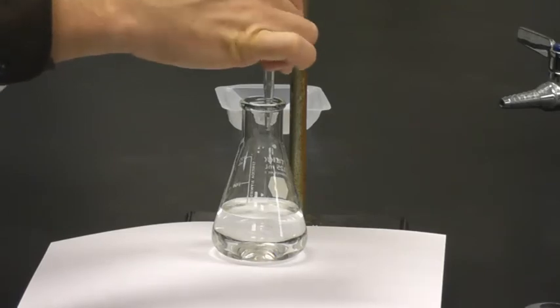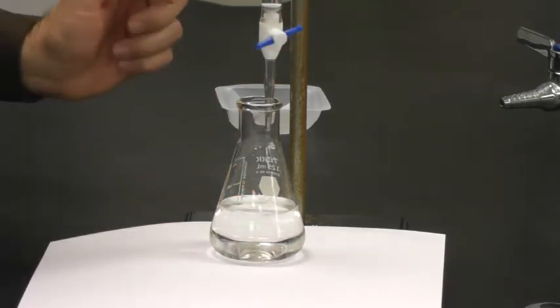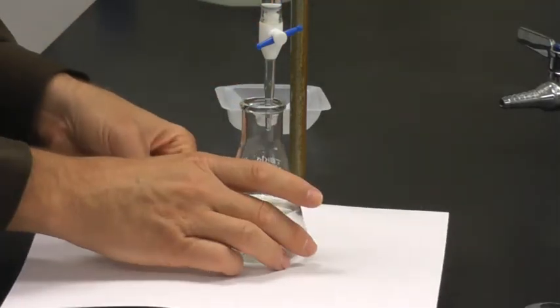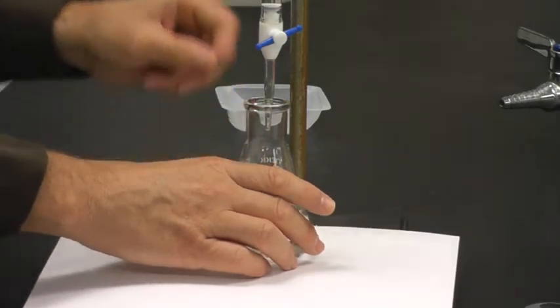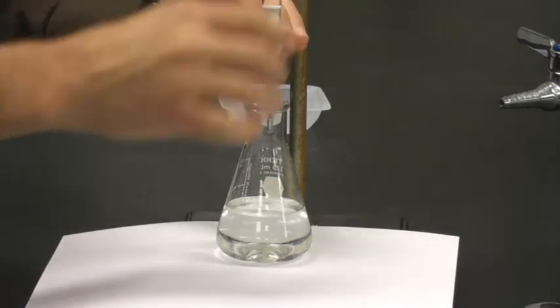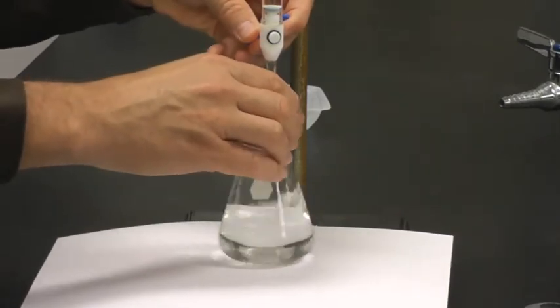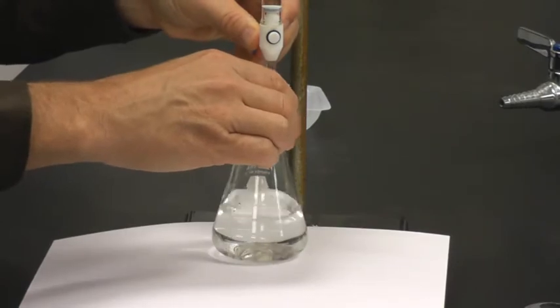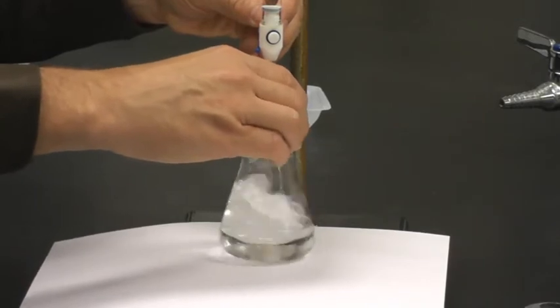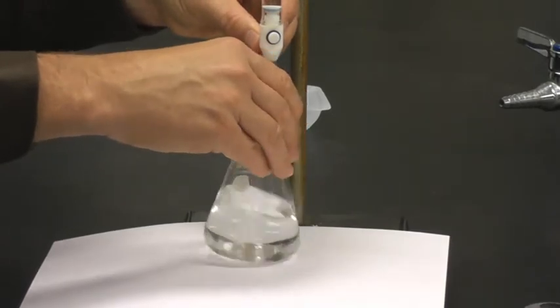So again, if I add some more in, and let it just sit, you can kind of see pink persisting. And as I cut it off, again, as that disperses my sodium hydroxide, it reacts with the KHP, not the phenolphthalein. So as you are adding sodium hydroxide, and here's where it gets tricky because I've got two hands and I'm trying to do a couple things. So I'm going to swirl with my right and add with my left. As that pink color persists longer, you want to add less and less sodium hydroxide at a time.